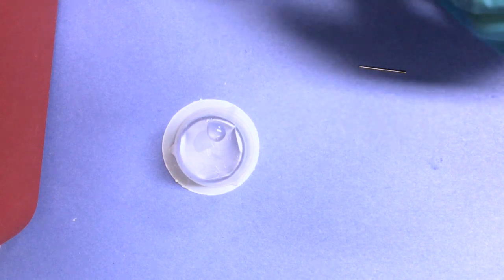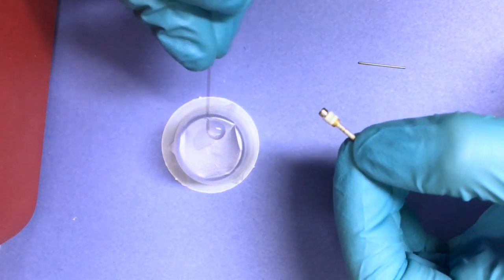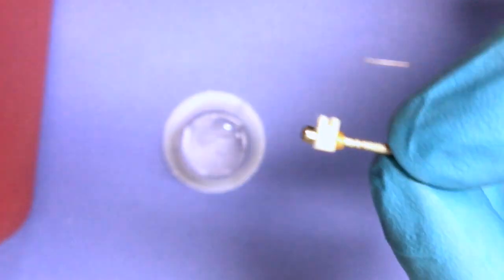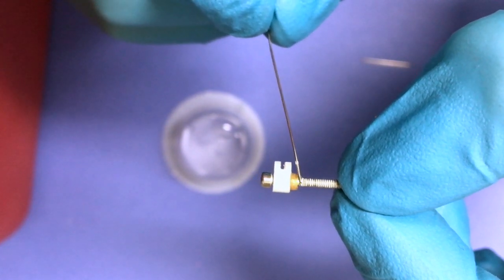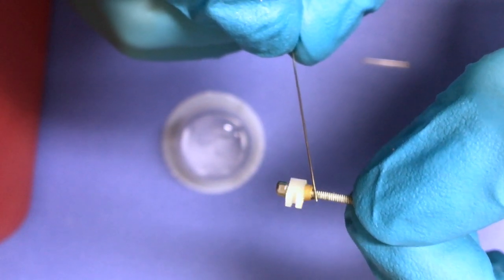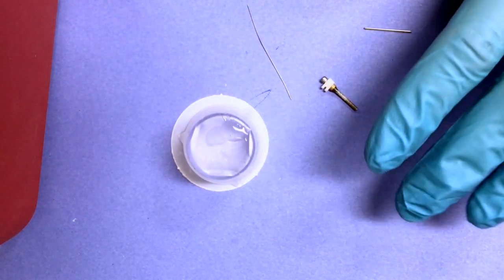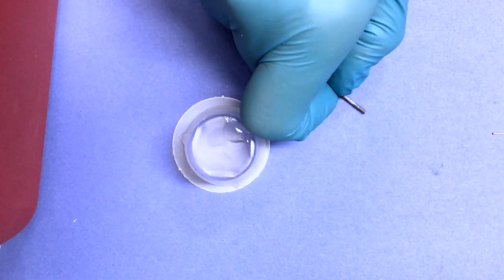When you are ready to apply the glue, the first thing you're going to want to do is to apply a considerable amount of that glue at the base of the gold nut on the hex screw itself. You don't have to go too far down the hex screw, but you want to make sure that you apply enough such that the carrier will remain attached and will not fall apart later in the construction process. Make sure you allow this initial gluing time to dry.